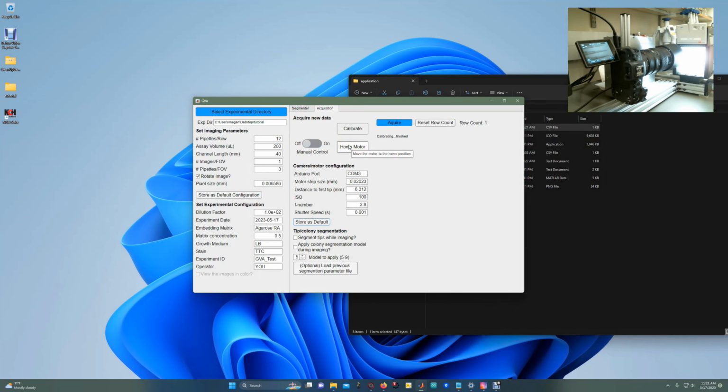And now whenever you hit home motor, it will go to the limit switch and then go back to that exact same position, so that you're looking at the first 3 pipette tips. So for this particular design, pipette tip A1 is on the top of the box, looking from the front, and then works its way down. So this is A1, A2, A3, A4, A5, A6, so on down the line. And so the imaging box moves this way to take pictures in that order.